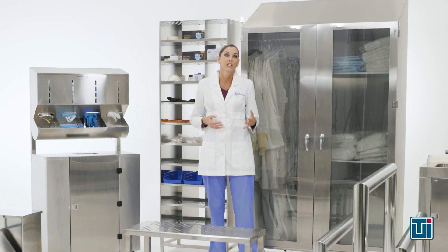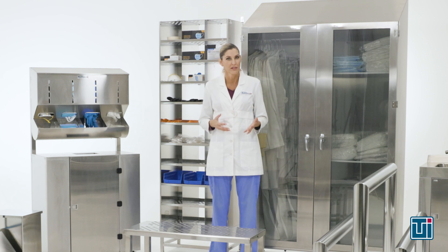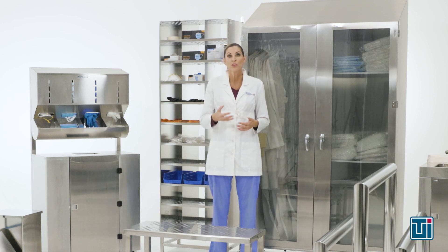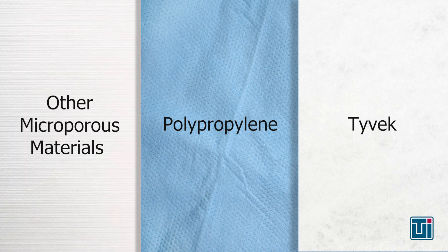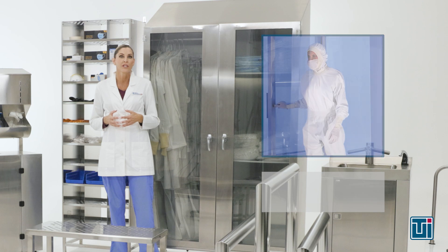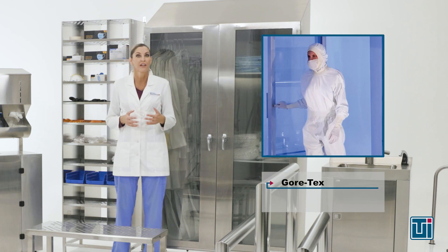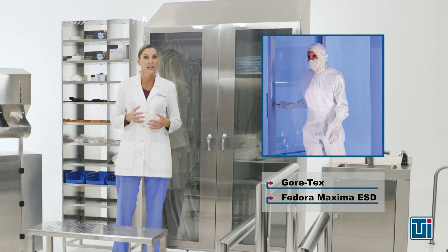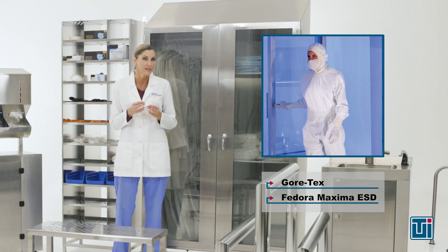For the clothing itself, clean room coveralls are available in a range of materials. Disposable coveralls are generally made from Tyvek, polypropylene, or a similar microporous material. Reusable garments are made of Gore-Tex or an application-specific fabric like Fedora Maxima ESD, which is designed for static-sensitive environments.